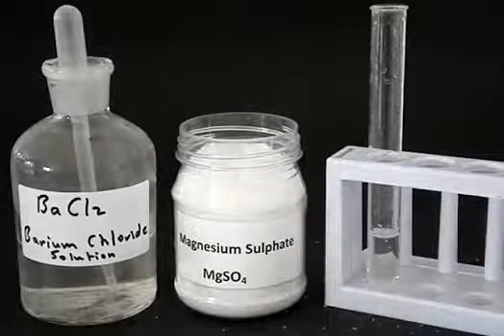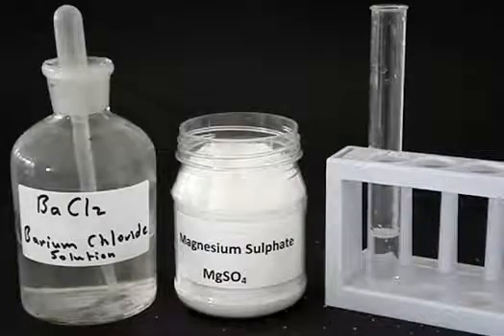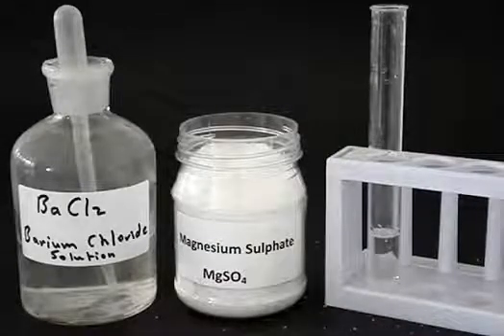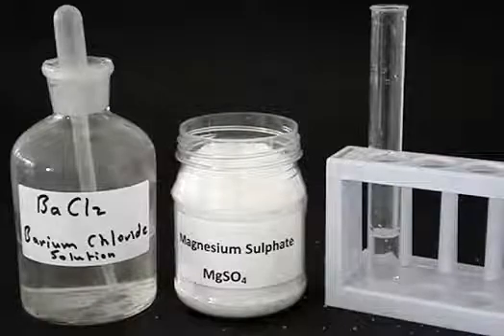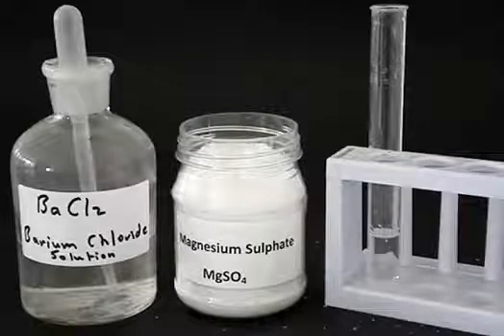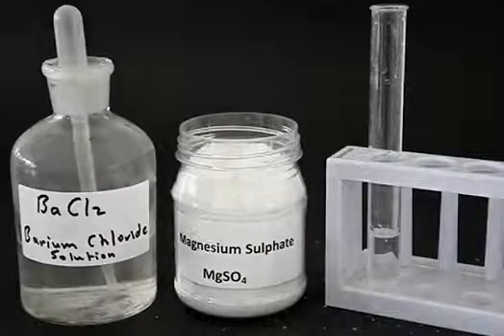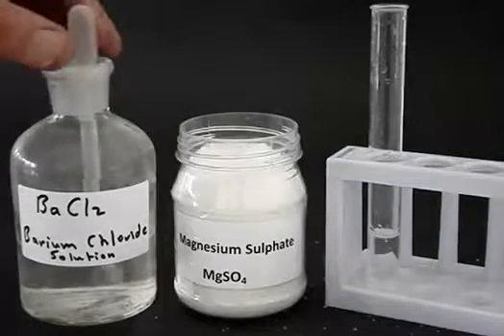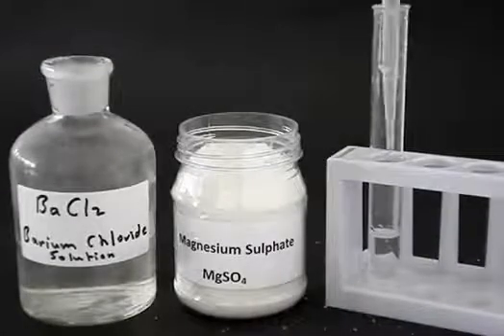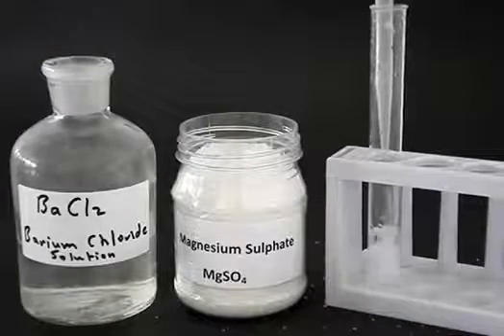We hypothesize it might be a sulphate, so we do the test for a sulphate. In the test for a sulphate, we add a bit of barium chloride solution. Barium chloride solution contains barium ions — Ba2+ ions — and Cl- ions.